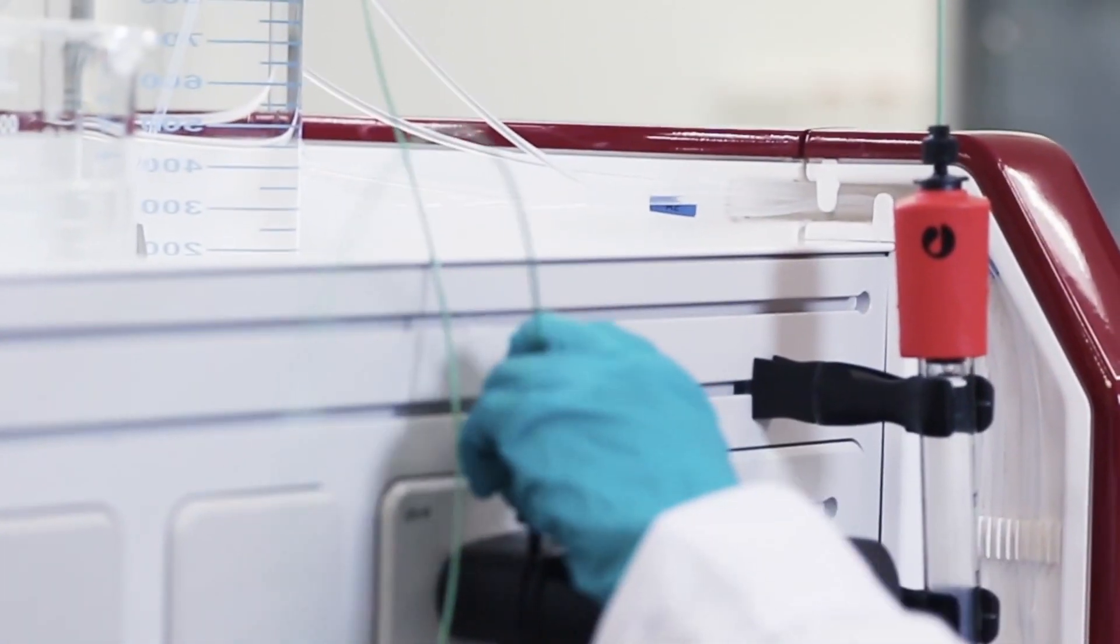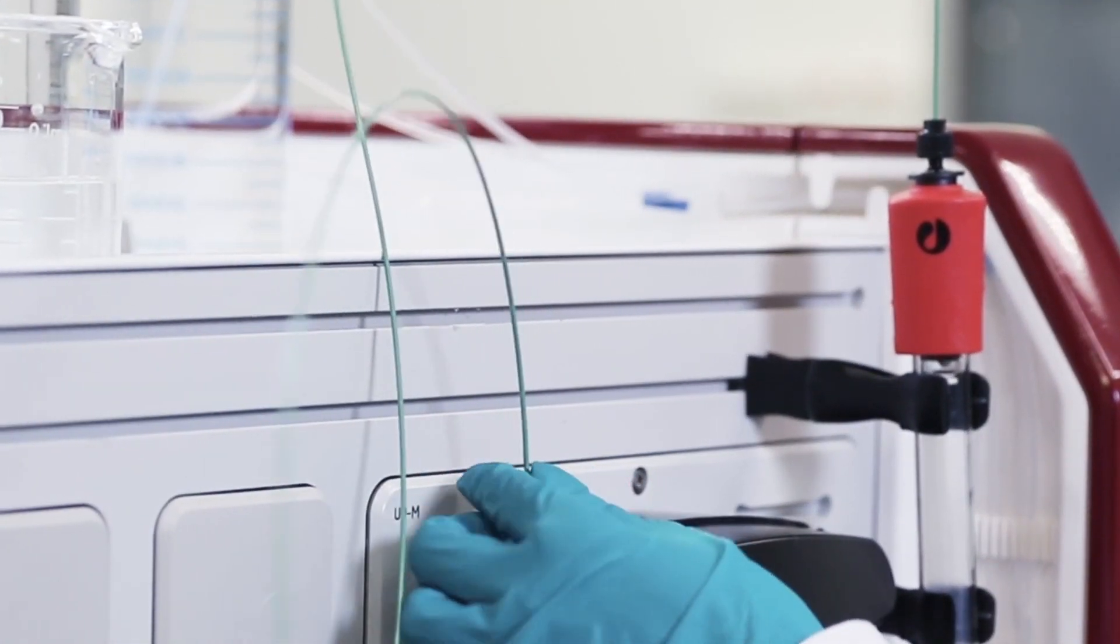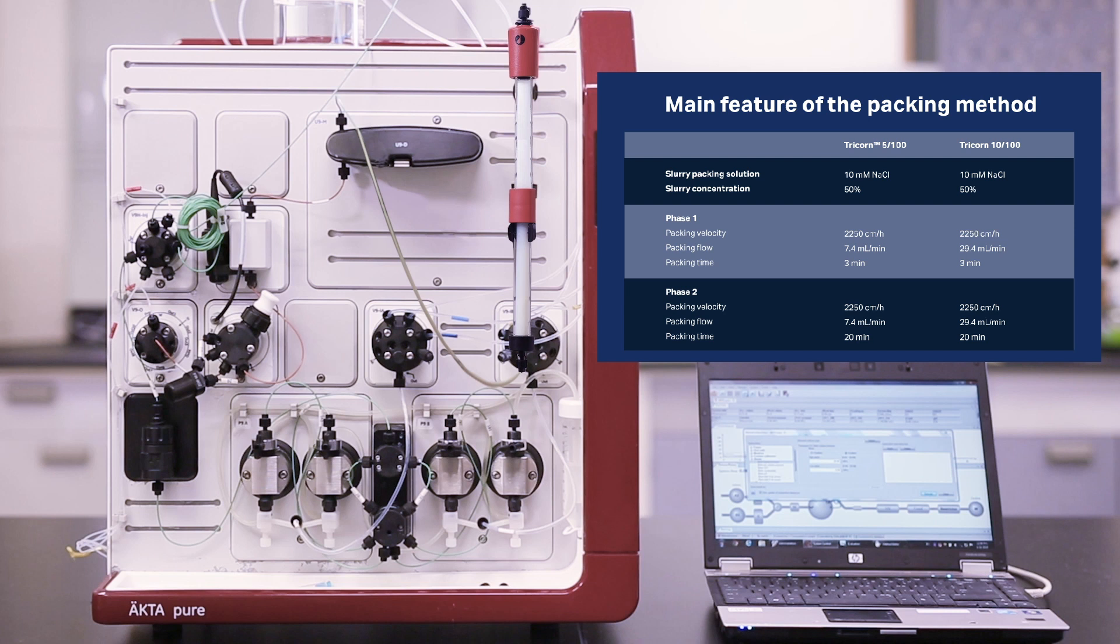After a final check, start the pump at a flow rate that is recommended for your resin. Different flow rates are used for packing different resins. Some resins are packed in two phases. Please check the packing instructions before starting the flow.